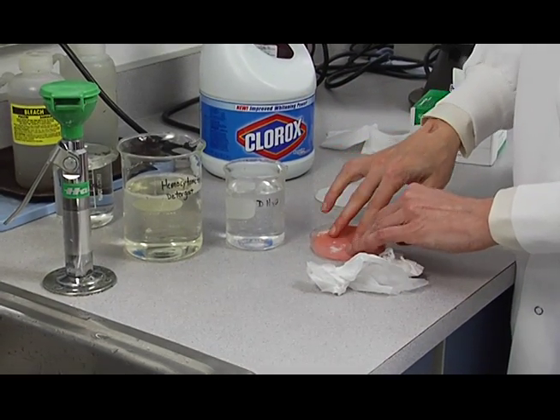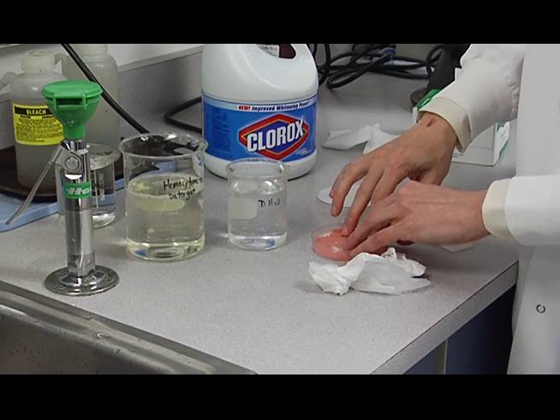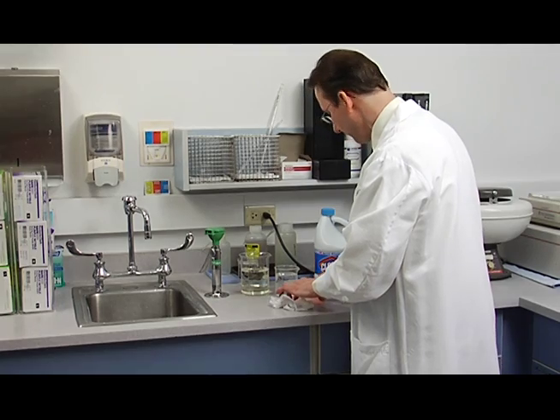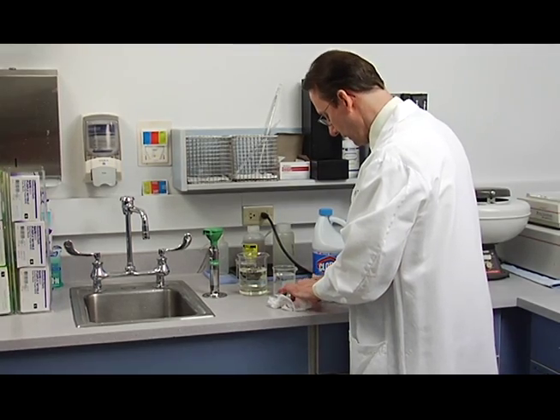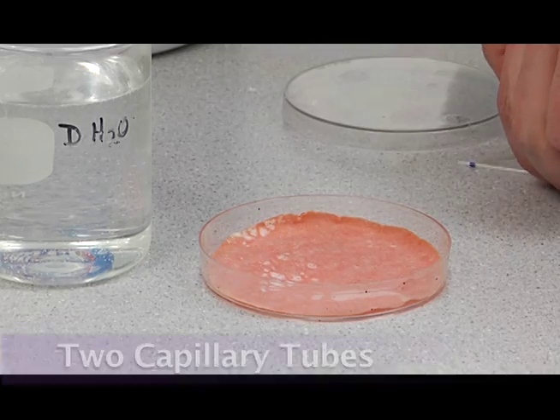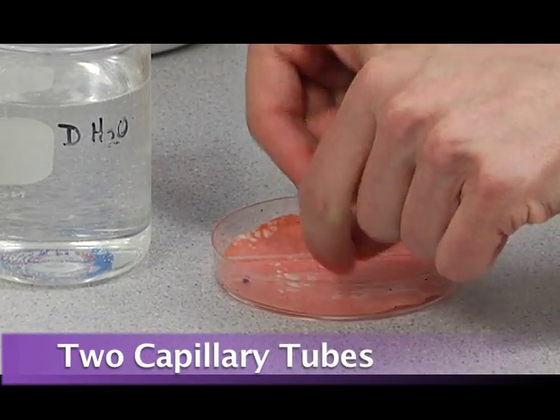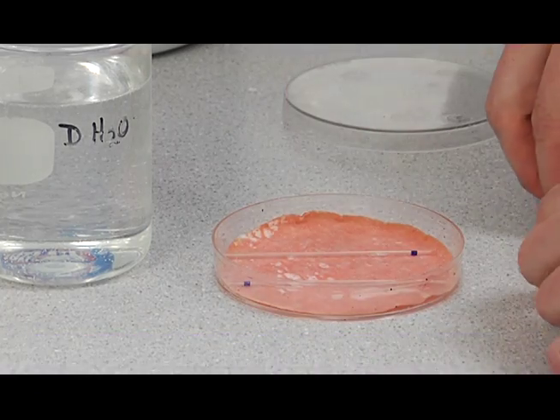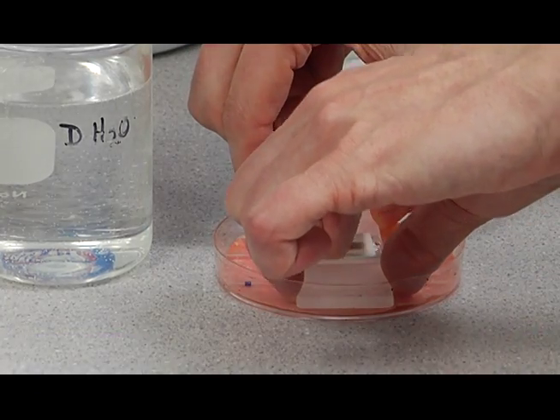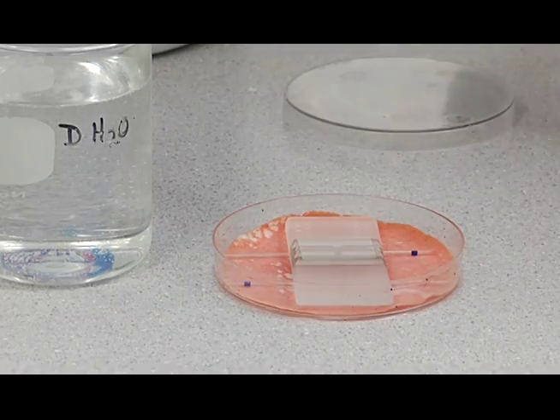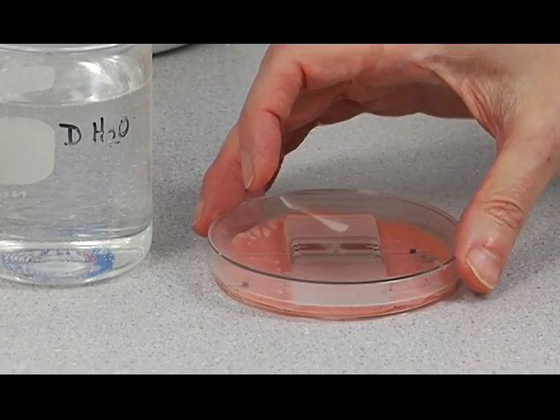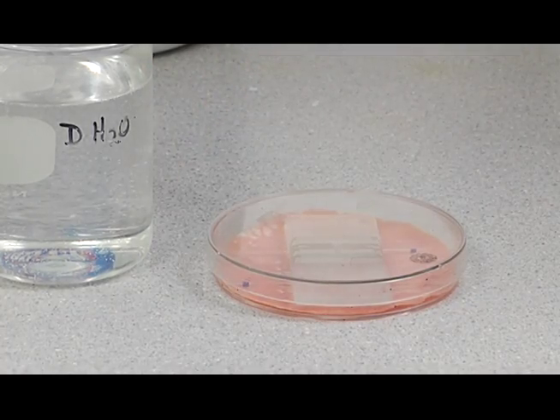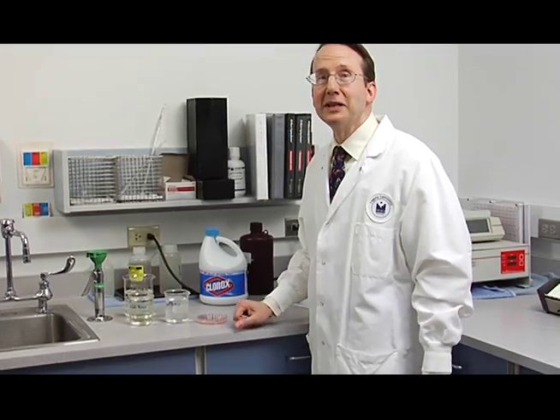So this looks just about right. You can also add water with a pipette, with a transfer pipette if you like. Then we're going to put these two capillary tubes in there just to lift up the hemocytometer. It makes it a little easier to lift it out. And then we'll cover it to keep dust out of it. Now we have completed the washing of the hemocytometer.